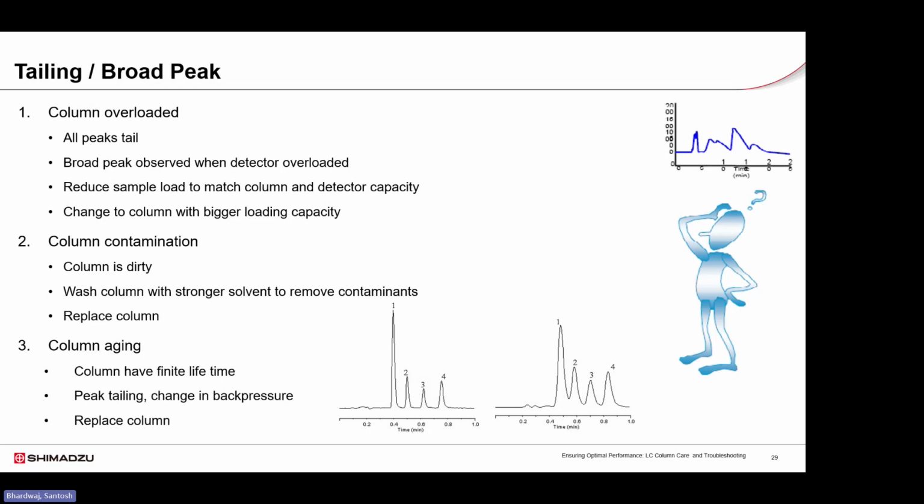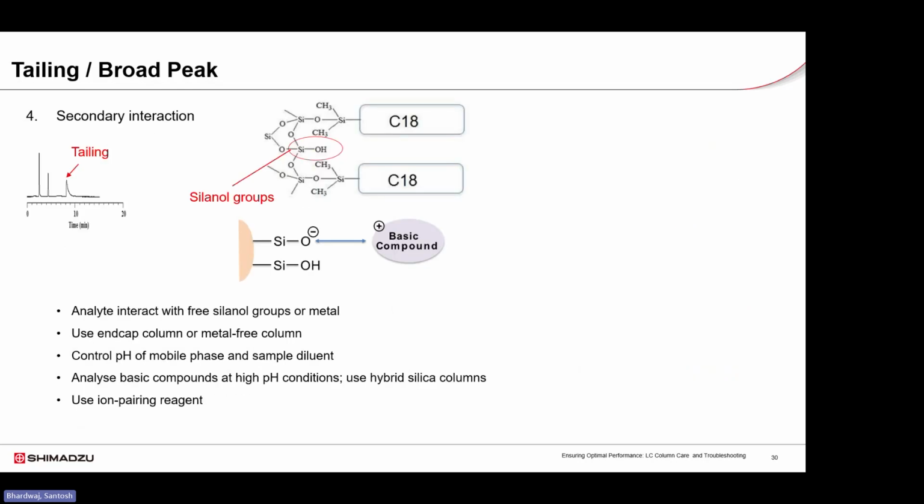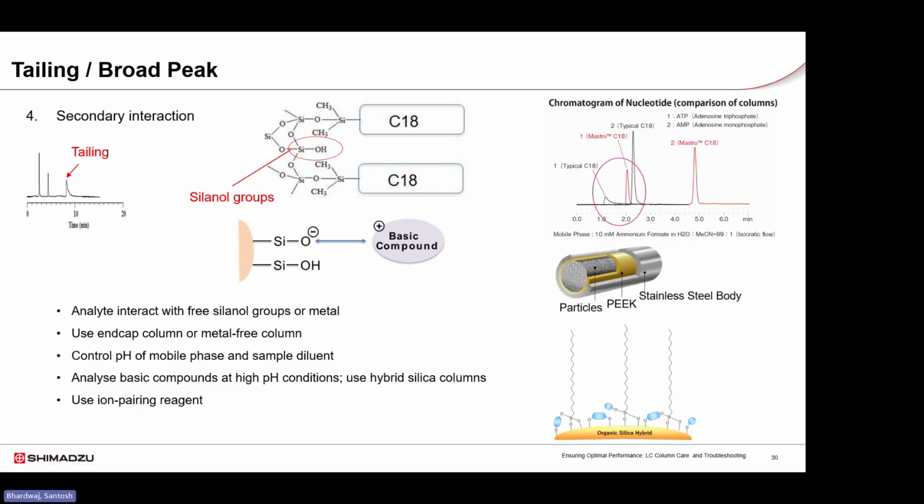at the appropriate time. Secondary interactions are a common cause of peak tailing, especially for basic compounds. Free silanol groups on silica surfaces or metal surfaces in the flow path can interact with positively charged analytes, leading to tailing peaks. To reduce these interactions, using end-capped columns and metal-free hardware can be very effective.